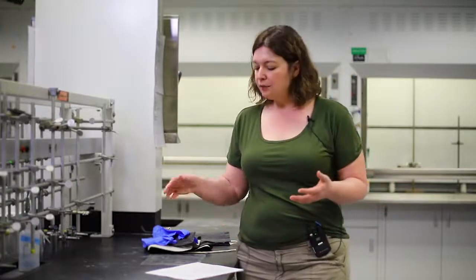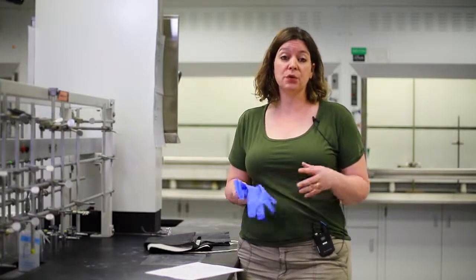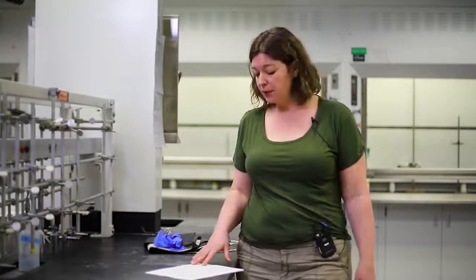Absorption is another way that you can be exposed to hazardous materials. This is also known as skin contact. So if you set your hand down in something, or if you spill something on your skin, it can absorb through your skin. We may have you wear gloves or an apron or something to prevent skin exposure in that way. You can ingest hazardous materials, which means eat or drink these materials.